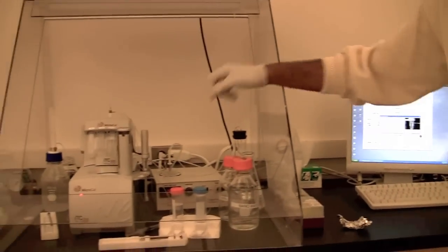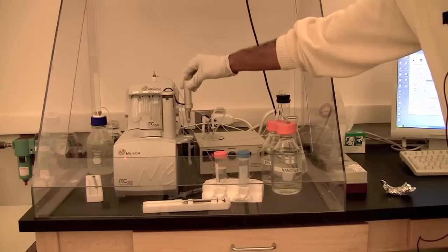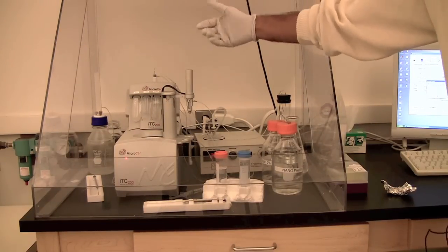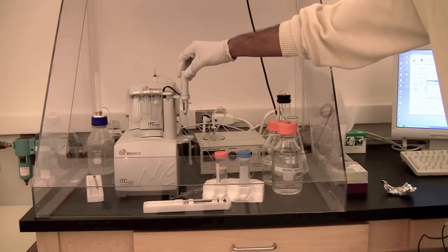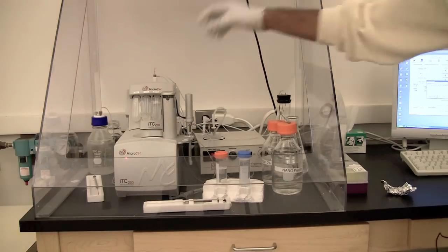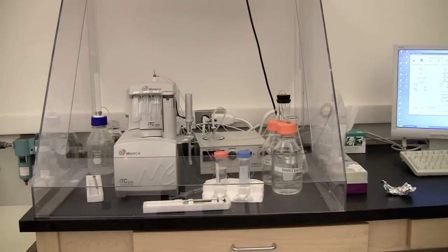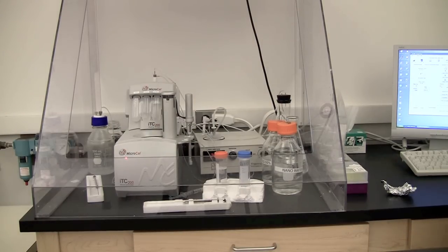There is the wash position and another position which is the rest position. If you have to load the solution that will be the third position, the loading position. Right now we have to wash it, so take it back to the wash position, click OK, and you can see it already starts washing the syringe.